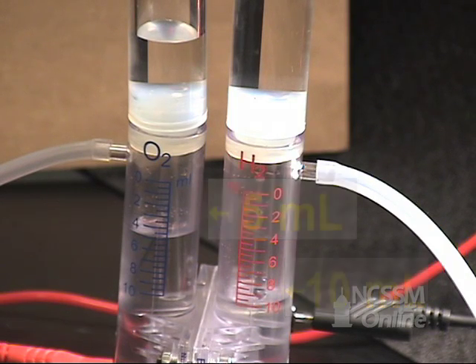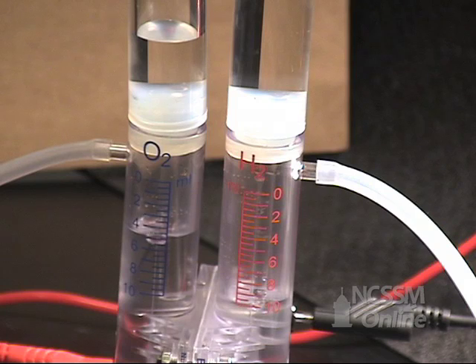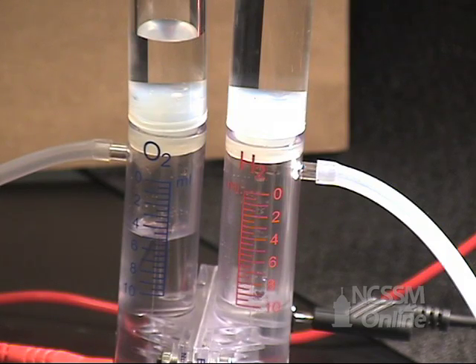So now we have confirmation that indeed water is two parts hydrogen, one part oxygen. And our molecular formula, H2O, we now have some evidence to demonstrate.